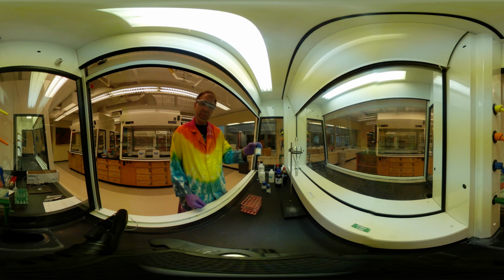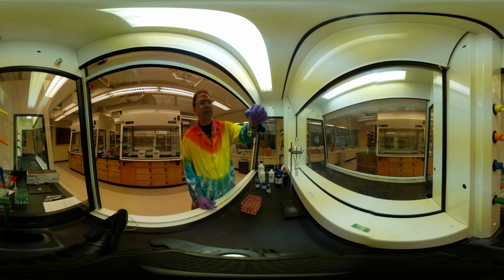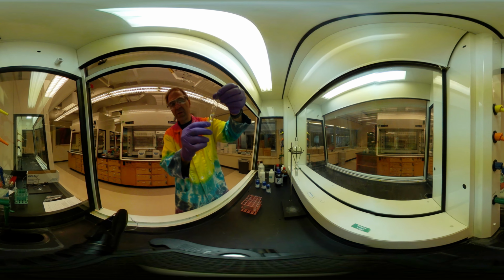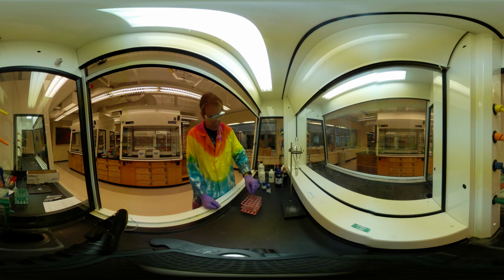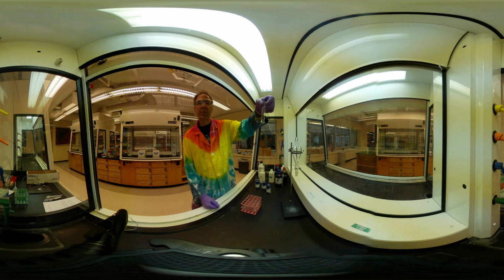And then last but not least, we have naphthalene, very strong smelling. It's what's in mothballs. And so we look at that, completely insoluble in water. All right? It's an organic compound, not necessarily surprising. It doesn't look very soluble, right? I got big chunks here in the HCl, so also not soluble in HCl. Sodium hydroxide, same thing, big chunks, not soluble. Then the dichloromethane, soluble, all right?